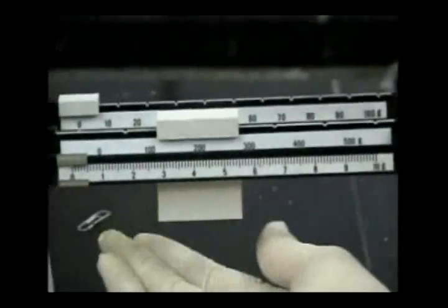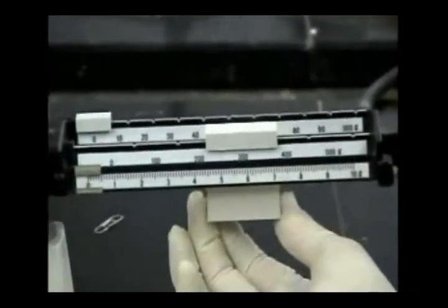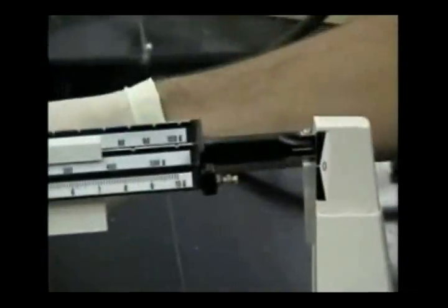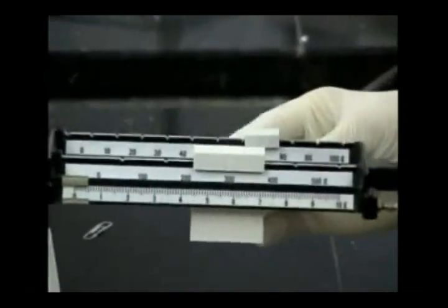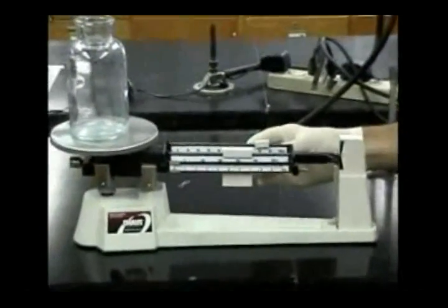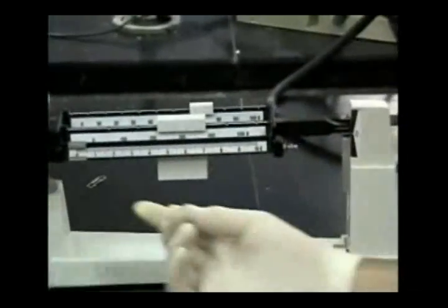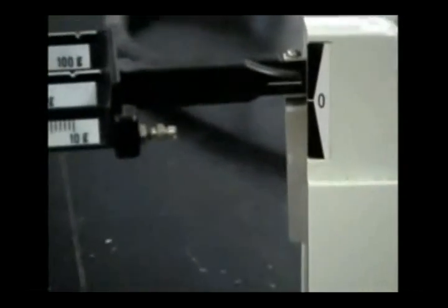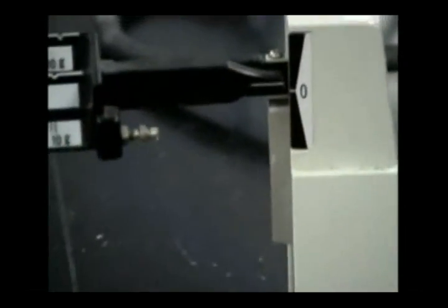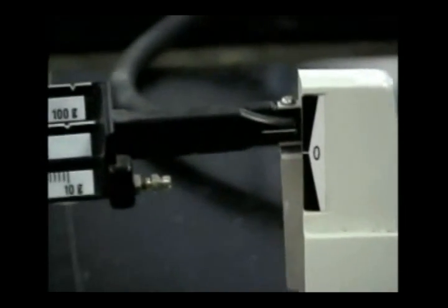We are now weighing the mass of the glass bottle by itself. The mass of the glass bottle by itself is 371.4 grams.